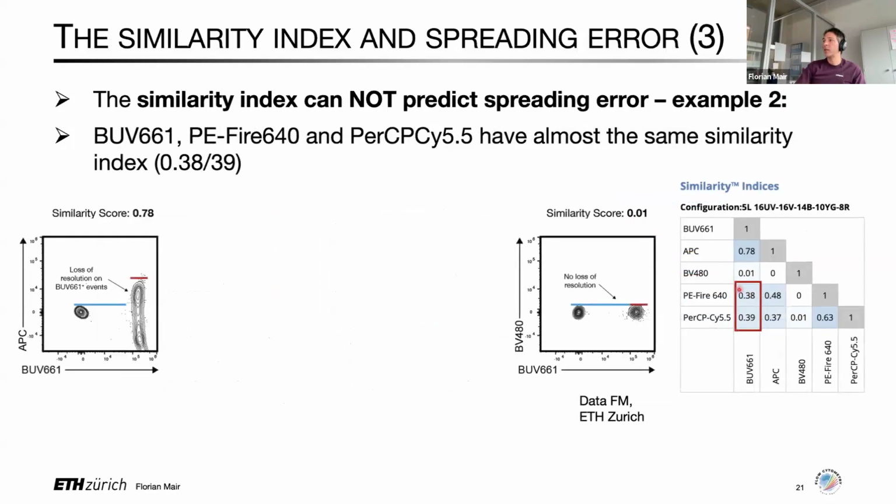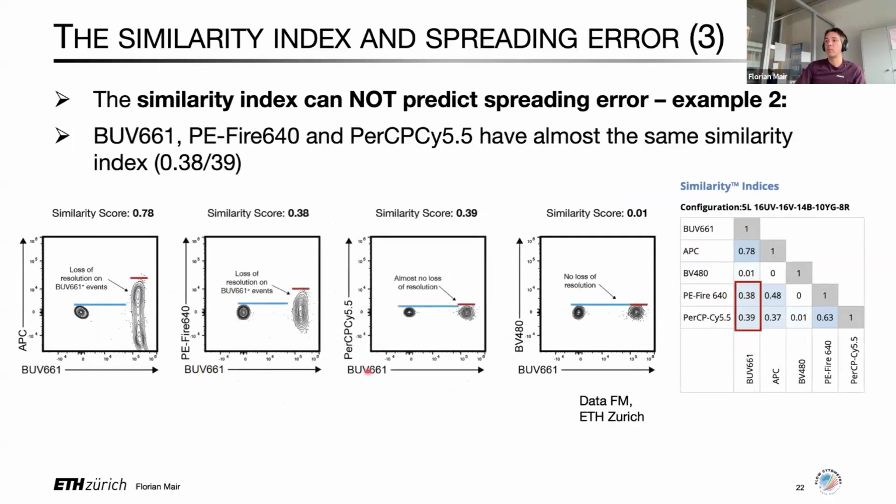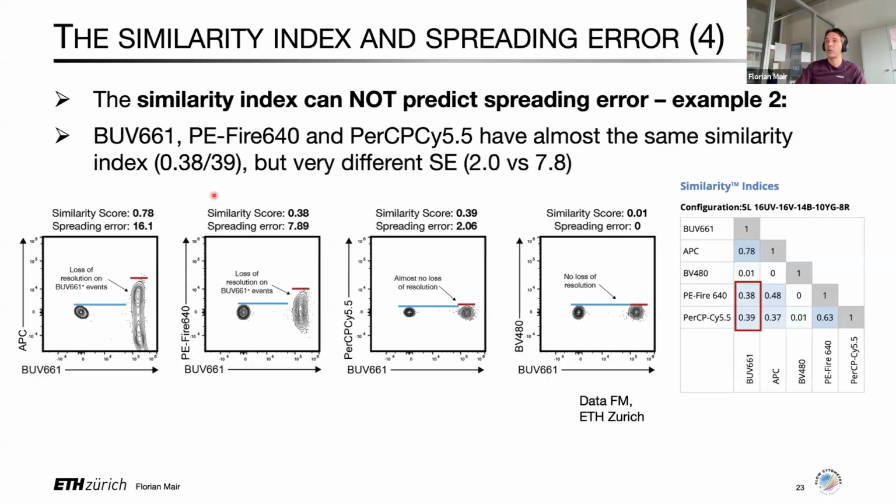The second example is in this middle space where you would say that BUV661 and PerCP-Cy5.5 and PE-Fire 640 are having a low similarity index. But again, if you look at those pairs, plotting BUV661 versus either PerCP-Cy5.5 or PE-Fire 640, you can see here in this case, you still have quite some spreading error. And in this case, it's low to negligible. And again, if you were to calculate the spreading error here, you would have immediately appreciated that that is the case. And as such, probably made educated choices about how you assign your markers to these fluorochromes.